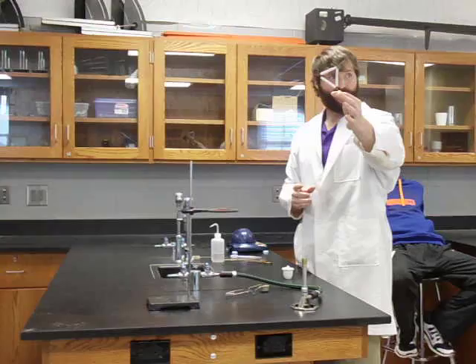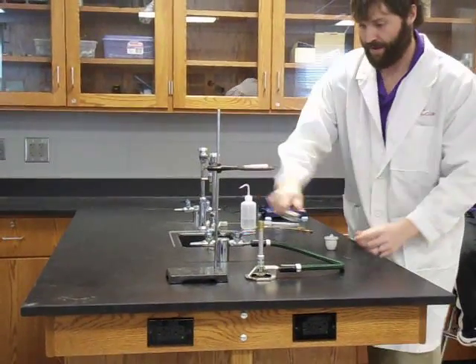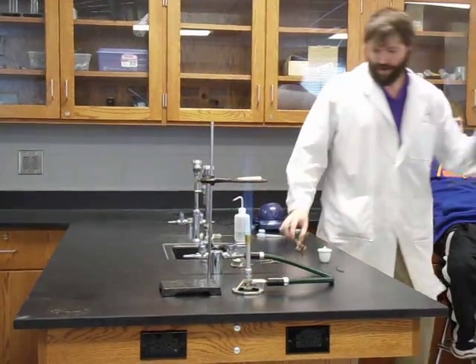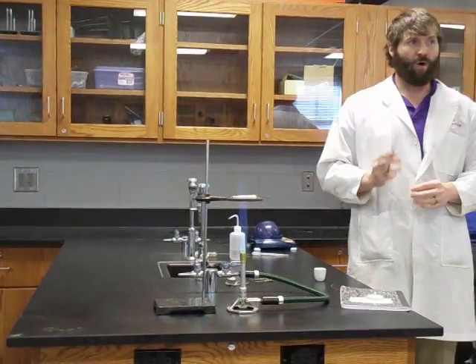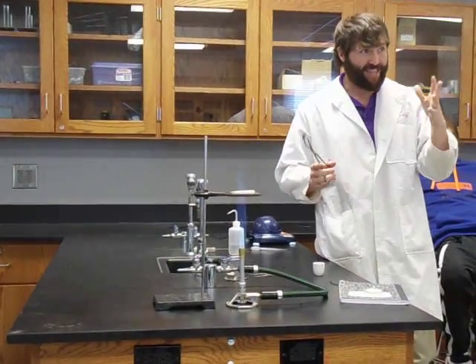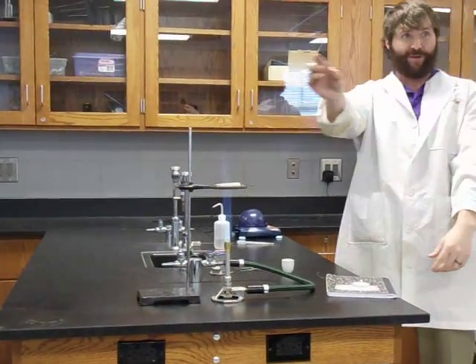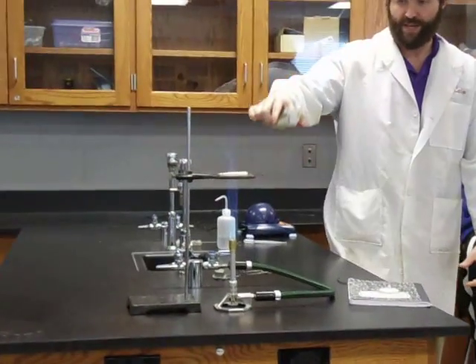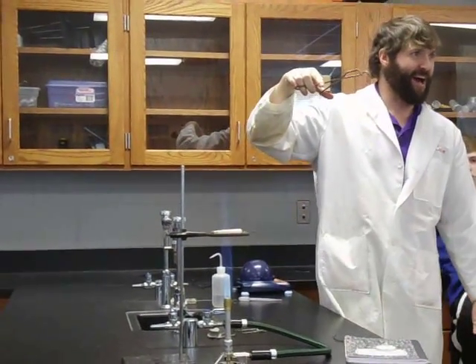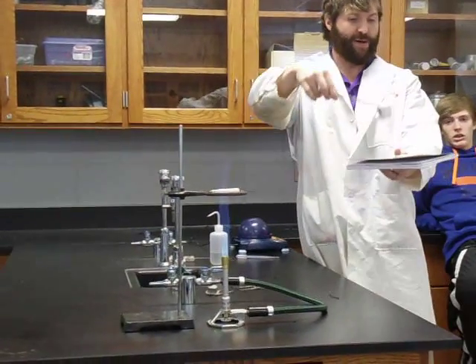Now I'm going to set up this burner over here. This is what's known as a clay triangle. This little clay triangle sits up on top of the ring. To move your crucible around in this lab, once you wash it, I don't want my hands on it anymore because your hands have got grease and oils on them. To move a crucible, use a pair of tongs — notice how they've got that little bend in the middle. Grab crucibles and move them with the tongs. If you're scared about dropping it, carry it with a lab book under it.